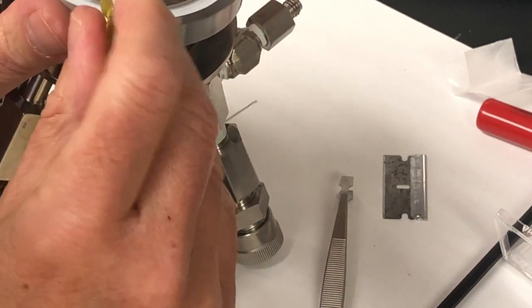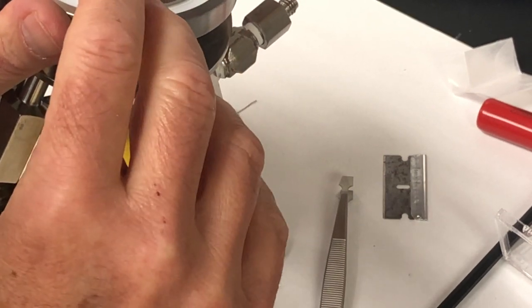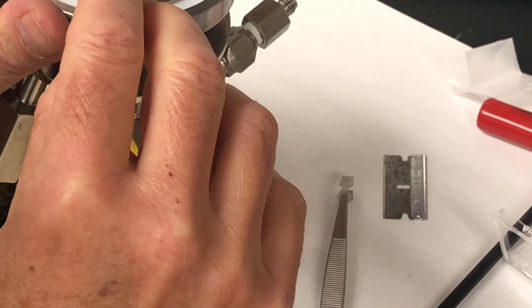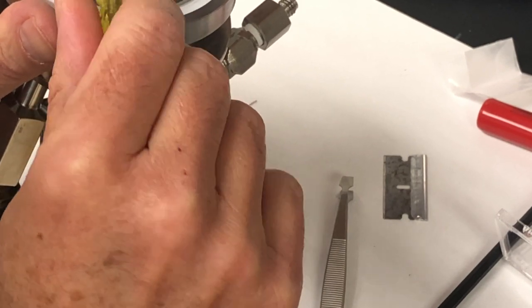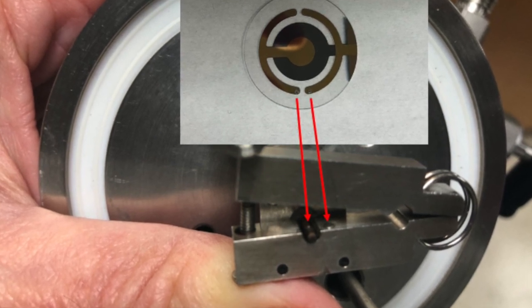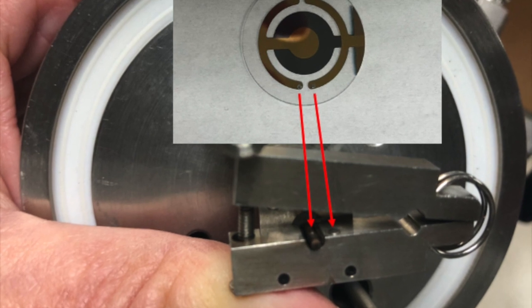And then we tighten the crystal adapter onto the crystal very carefully so that the adapter sides are in parallel. This photo shows the proper alignment between the two electrodes on the QCM crystal and the two electrodes on the QCM adapter.